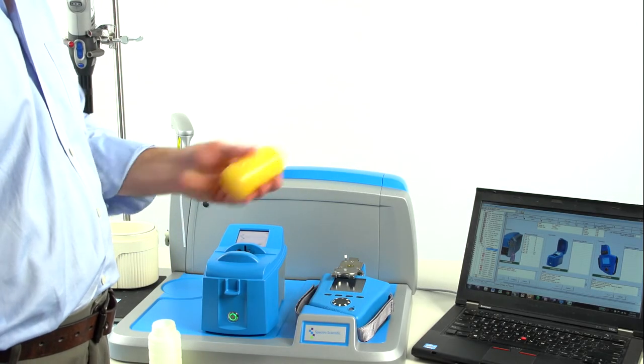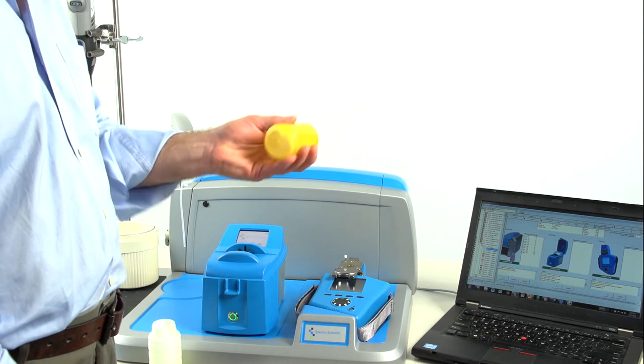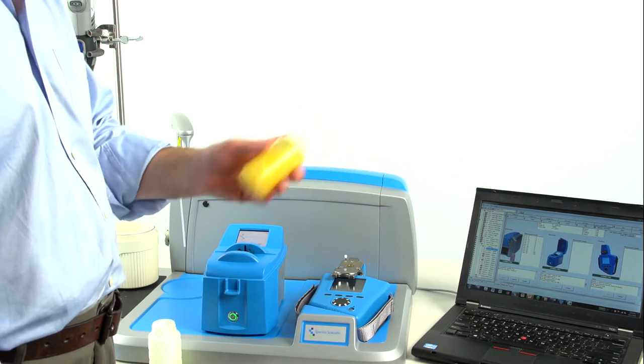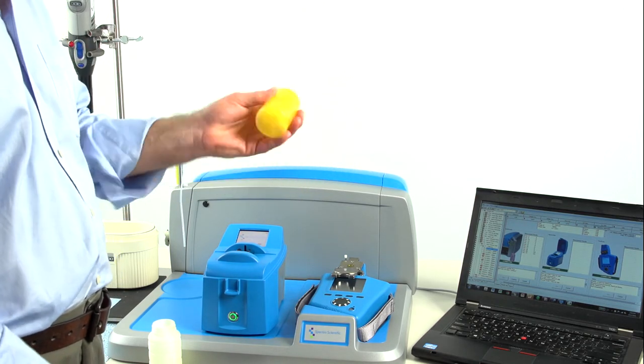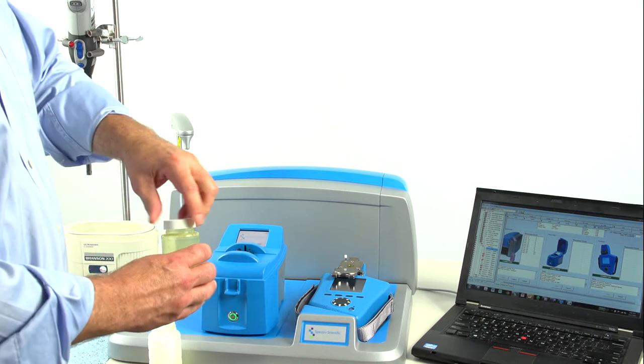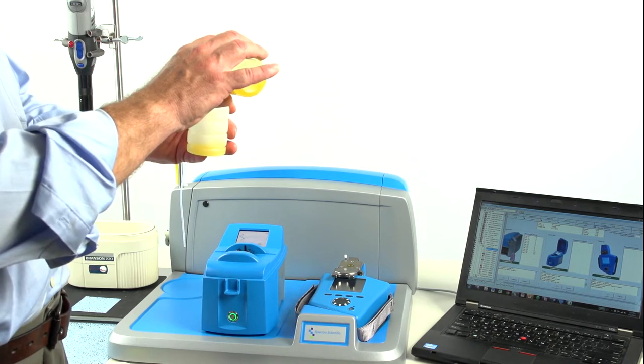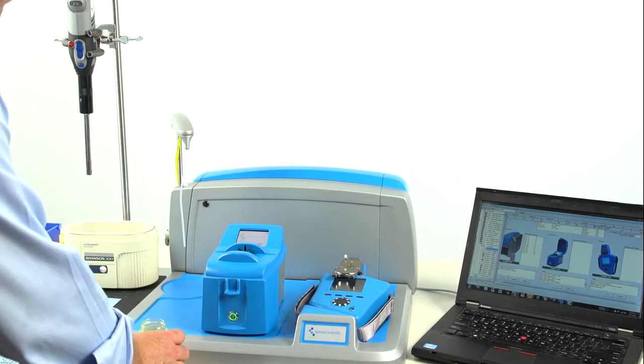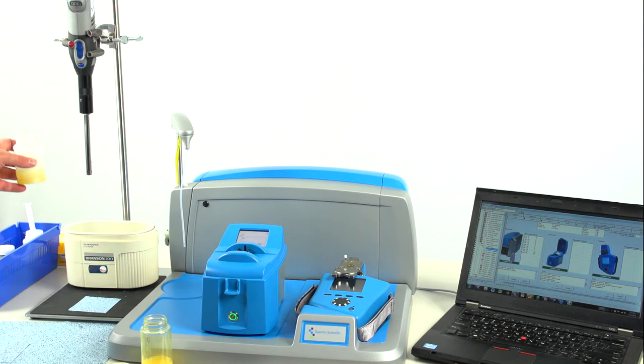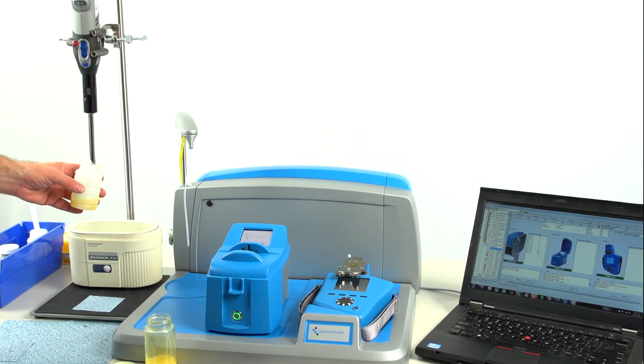Before any oil analysis it's always a good idea to agitate the sample to uniformly distribute particulate throughout. I'm drawing off the sample to use for the FluidScan.